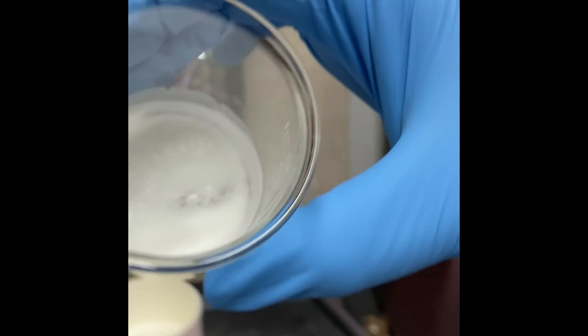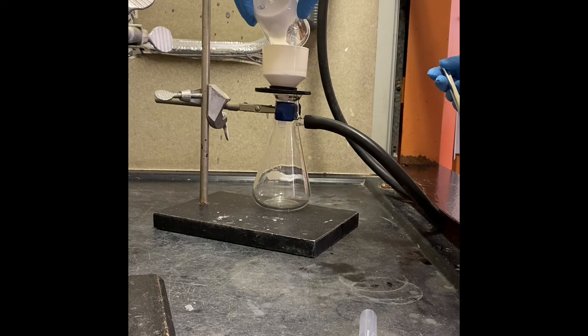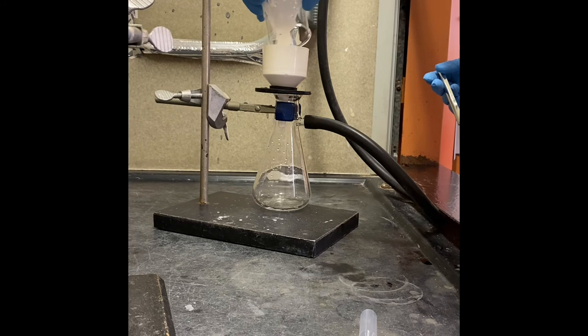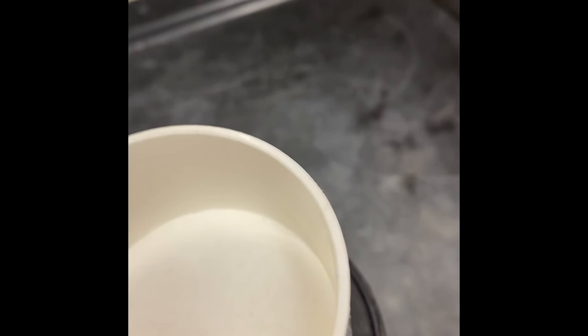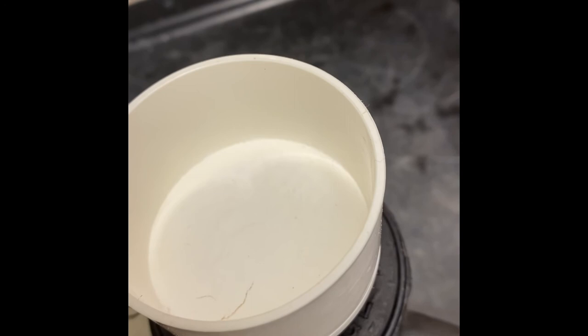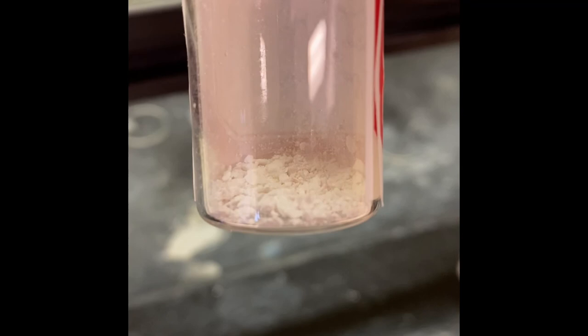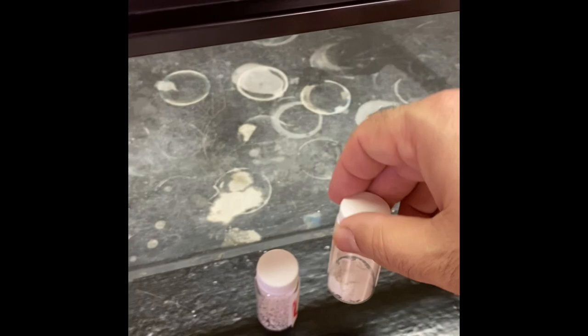2-chlorobenzoic acid is ready. Now I'm going to filter that up. I transferred everything - 2-chlorobenzoic acid, that's our product - and we're going to try to figure out how much product we have. The benzoic acid and alcohol. Thank you.